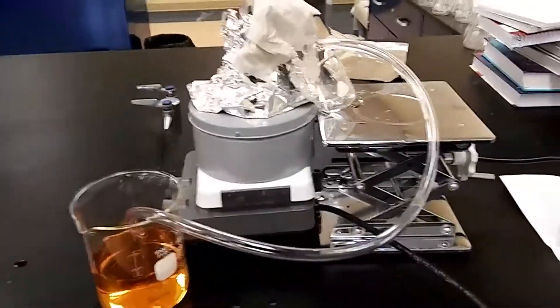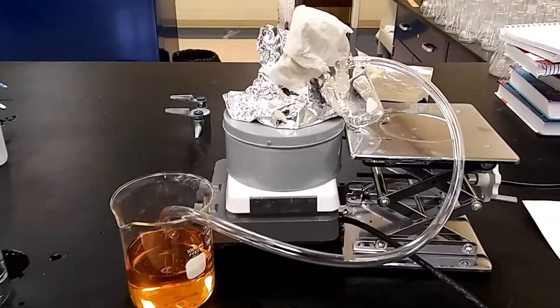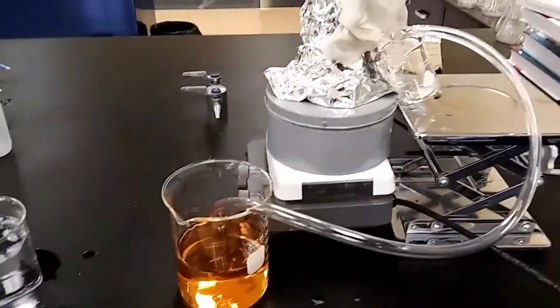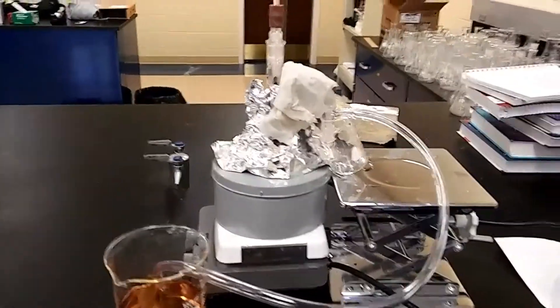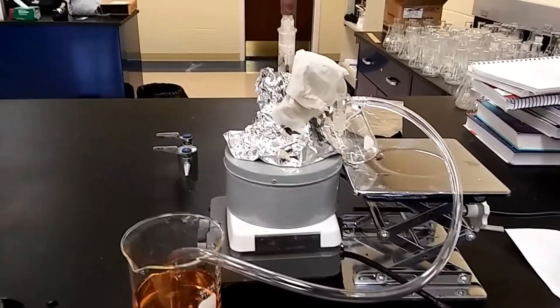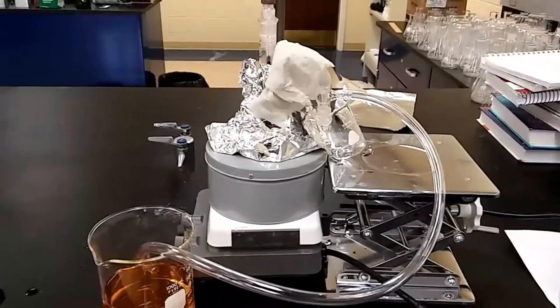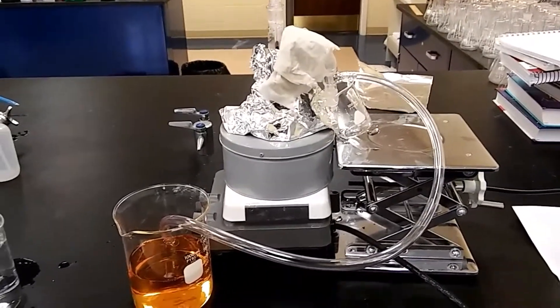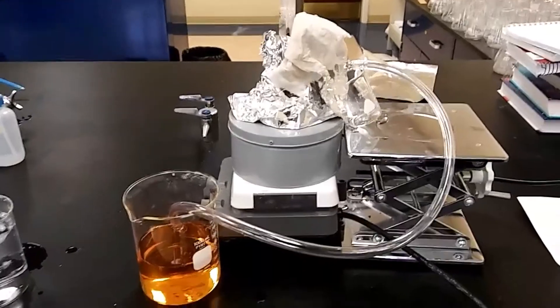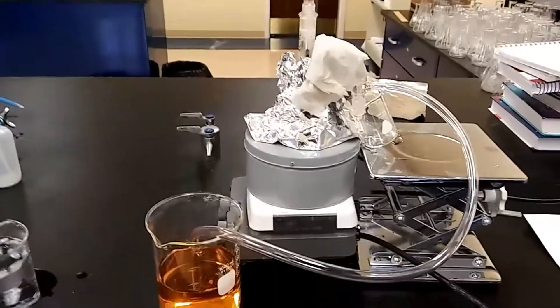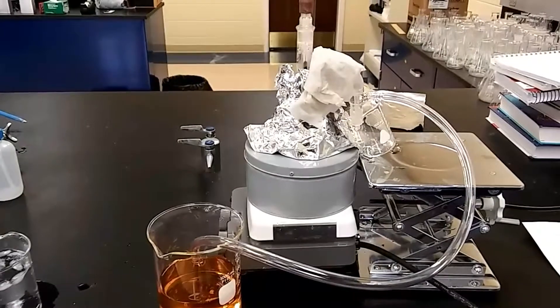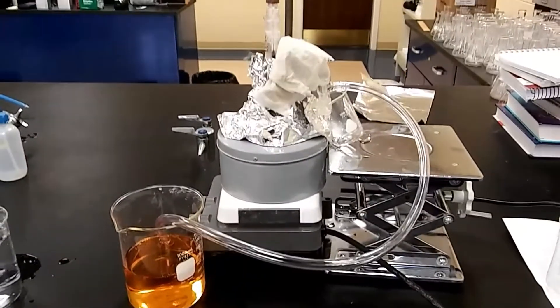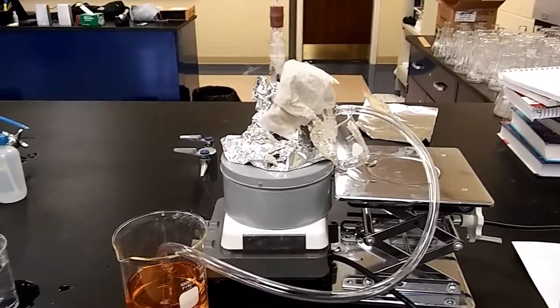It's been about 20-25 minutes. Let me walk you through what has happened in that time. I put a stir bar into the flask and weighed about 32 grams of salicylic acid, and set the temperature controller at about 25-30 because I don't want to put too much heat into a flask containing a dry solid. Then I let the reaction go with constant stirring. Initially nothing will happen as the CO2 is liberated, you'll start to see the solid melt. And then at that point, I went ahead and covered it with aluminum foil.